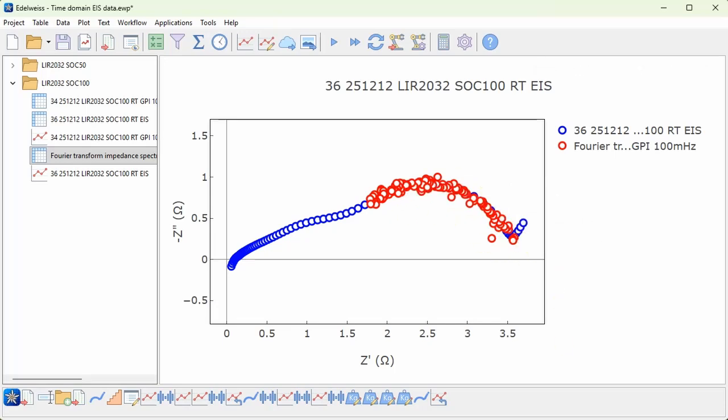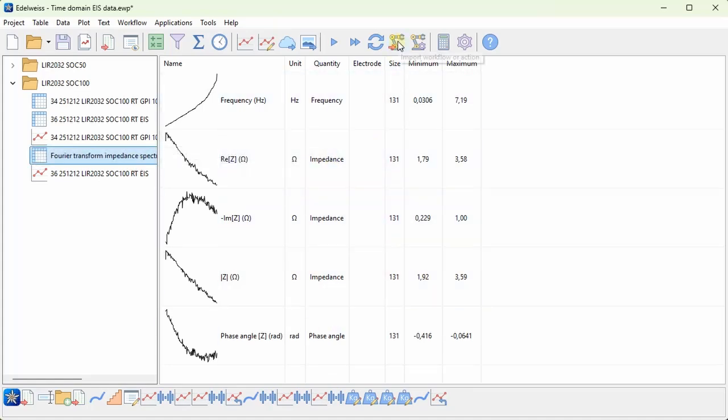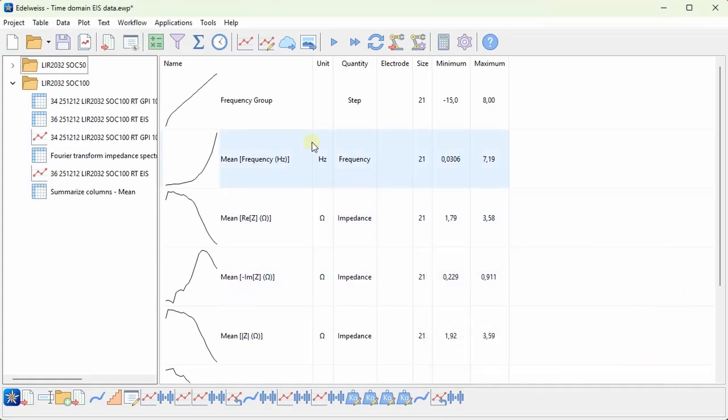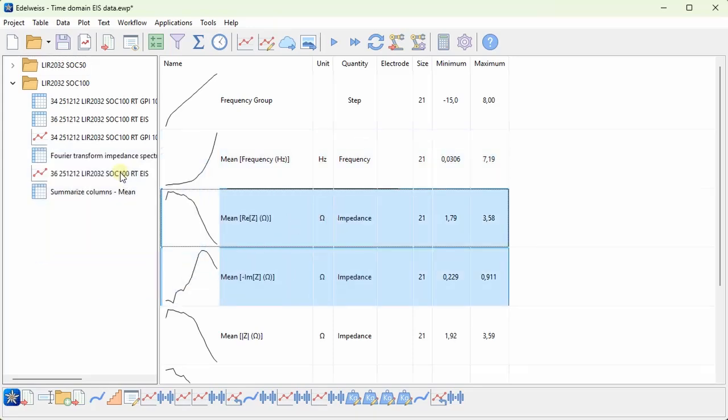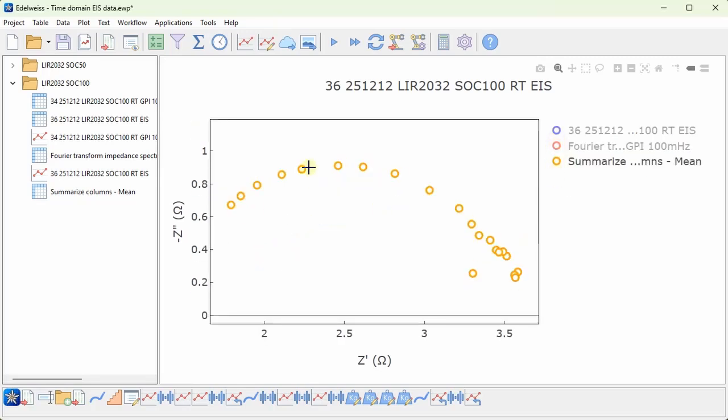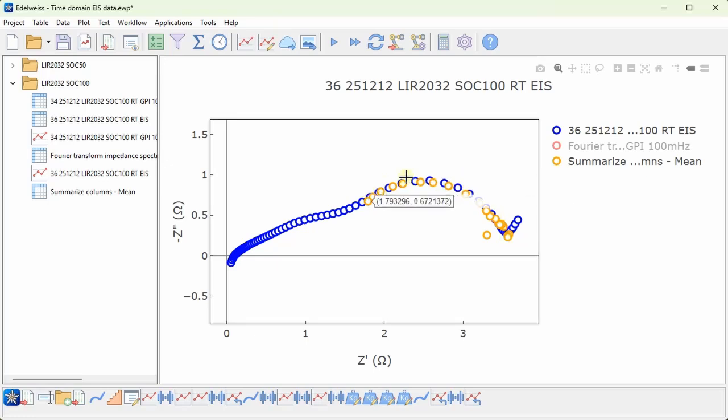And this has more to do with the fact that we get a lot more data points. So for a better comparison, we might want to smooth this. And I have actually created a little application as a workflow that we can import to smooth this data. So I'll choose import workflow. And I won't go in detail how this works, but it bins the data together to spread it out in frequency and get less noisy data. So if I add this, you might be able to see that we have a lot less noisy data, and this overlaps quite well with the actual impedance spectrum.